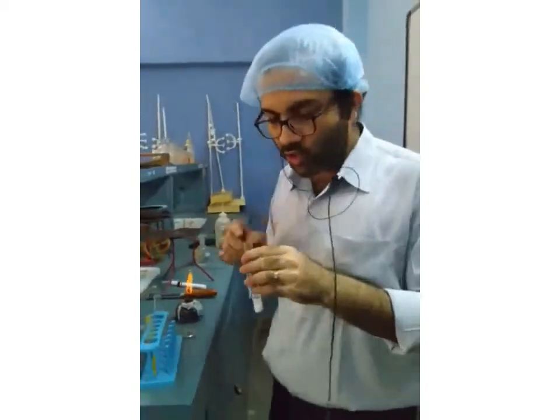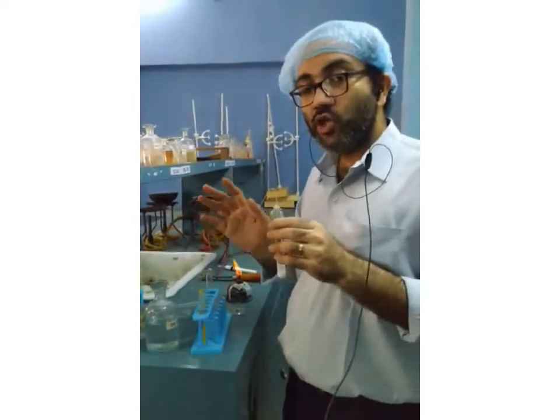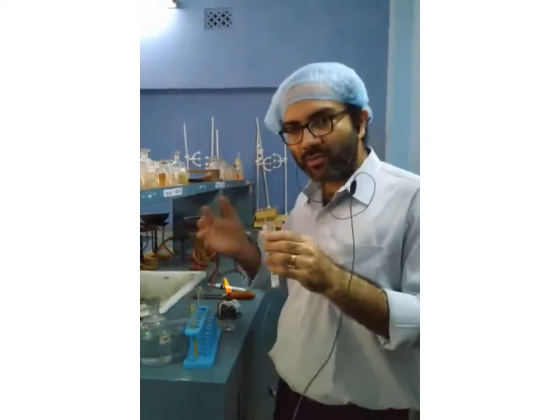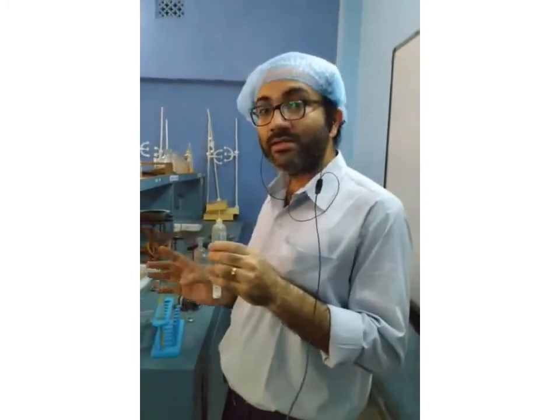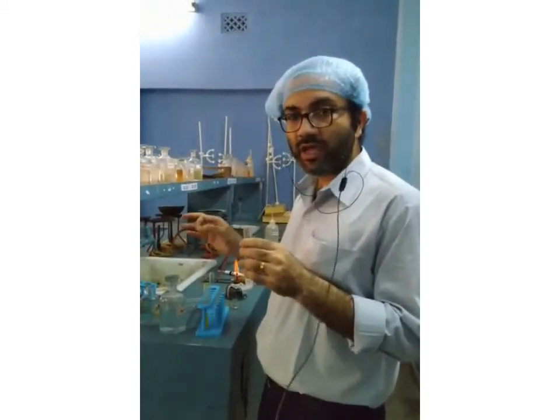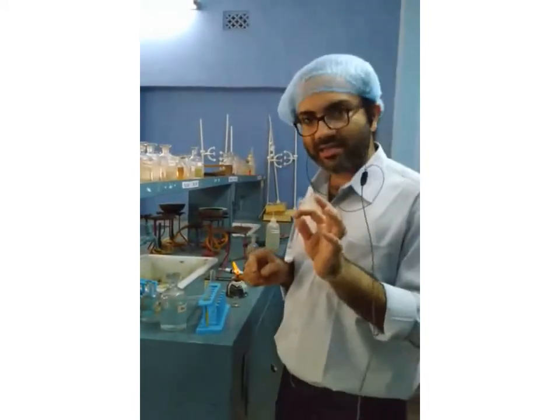Alright? Now, this one thing you shouldn't do, which I should mention over here: I have handled the acid bottles with my bare hands. But you are not going to do this with bare hands. We are carrying out experiments, we know the precautions, we know what to do and when to do, how to handle bottles. Though I have done that, scientifically it's not correct, and you shouldn't carry out these sorts of experiments with bare hands. You will use droppers and you will use test tube holders when you are performing experiments with acids.